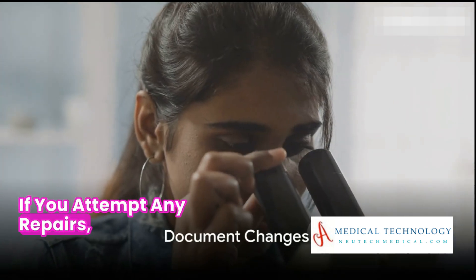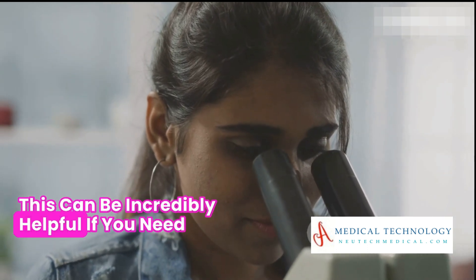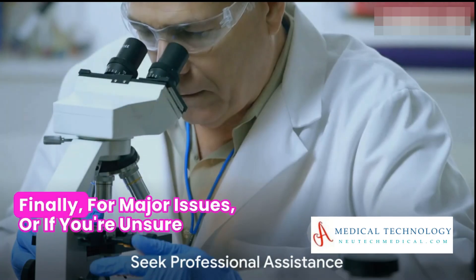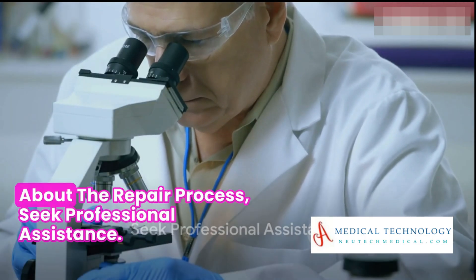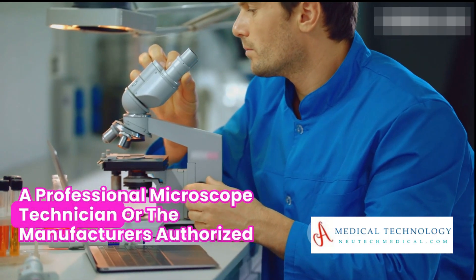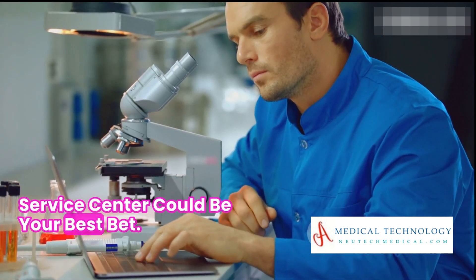If you attempt any repairs, document the changes you make. This can be incredibly helpful if you need to revert changes or provide information to professionals. Finally, for major issues, or if you're unsure about the repair process, seek professional assistance. A professional microscope technician or the manufacturer's authorized service center could be your best bet.